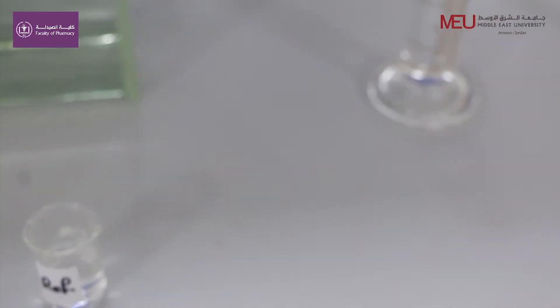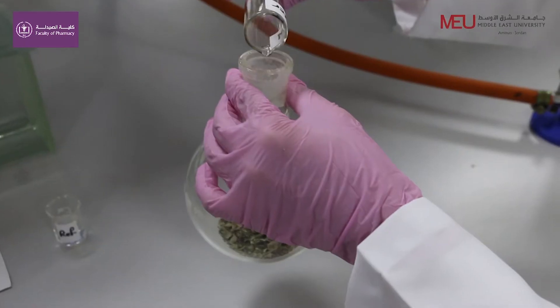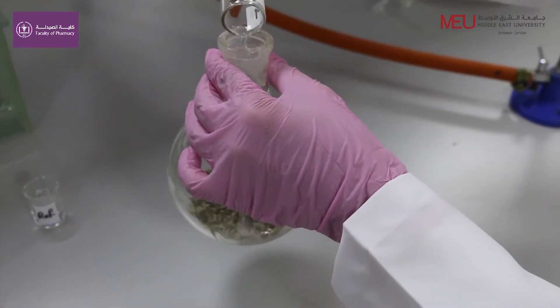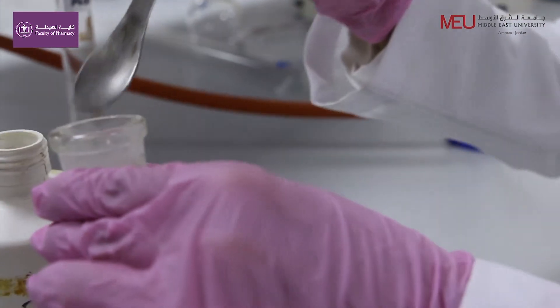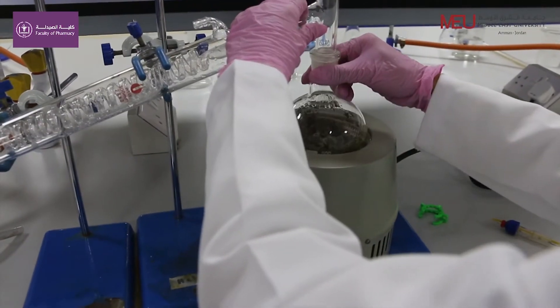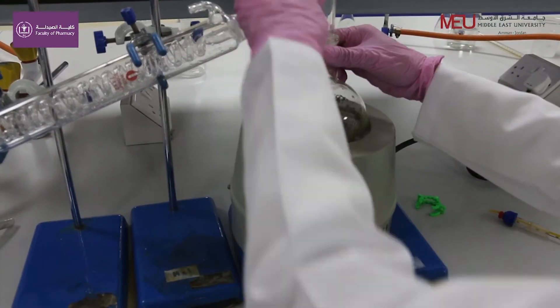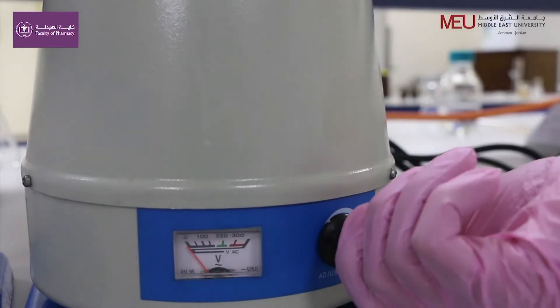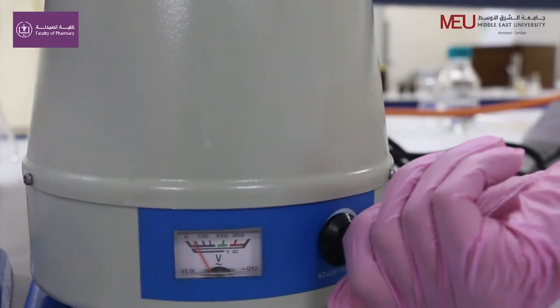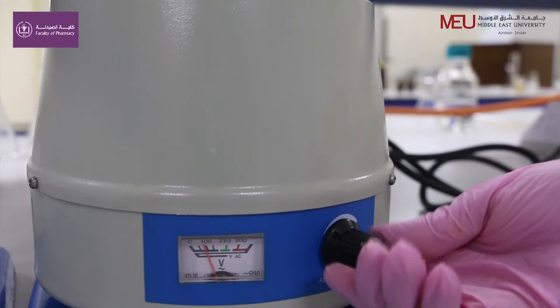Weigh 3 g of powdered plant. Add 10 ml distilled water. Add a few boiling stones and connect the round bottom flask to the distillation apparatus. Heat slowly with caution until the receiver tube contains about 2 ml of distillate.